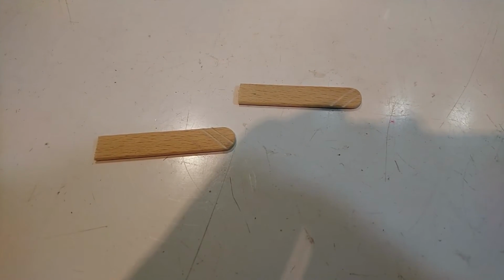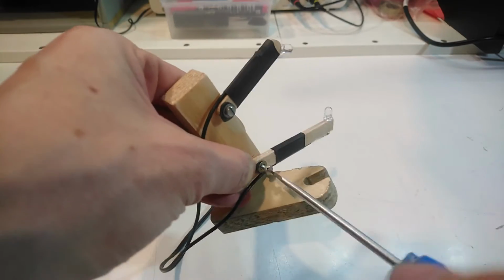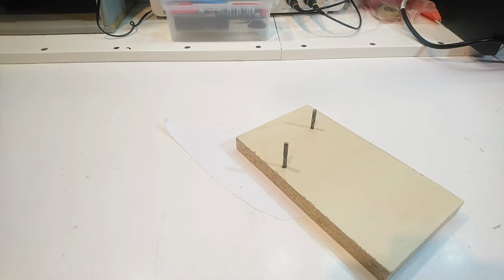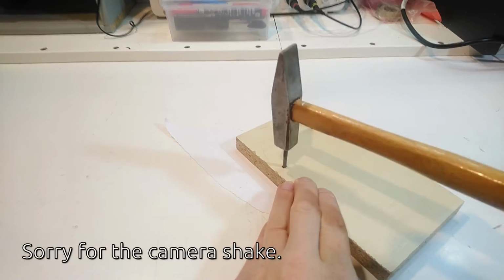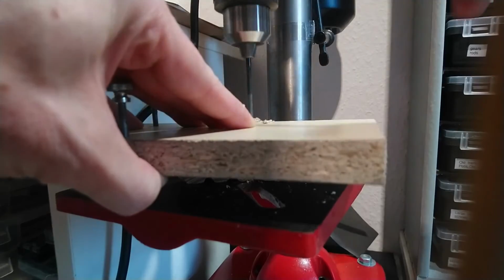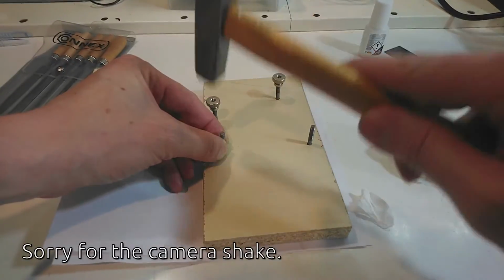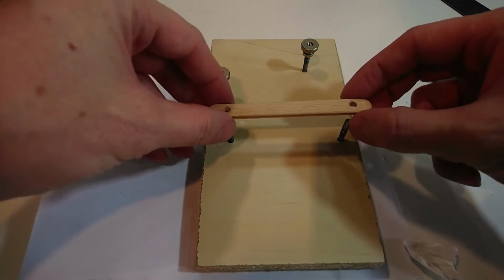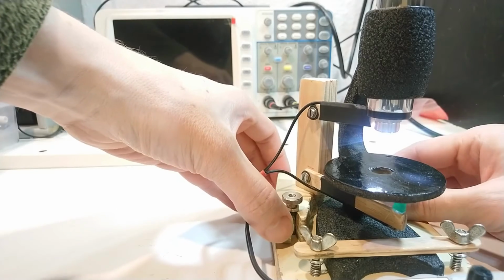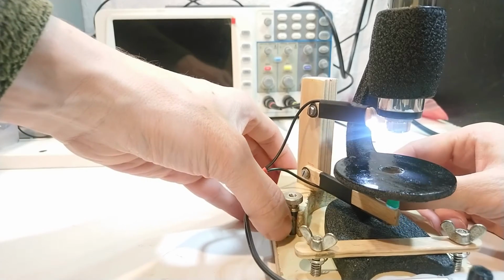I made two little arms that hold an LED at the end. They are attached to a little vertical tower that sits on a fiberboard stand. Then I make a base plate that has threaded rods glued in place to hold the tower in its position. Two more threaded rods are added to clamp down the microscope using a wooden clamping bar. That setup allows me to adjust the position of the lights and the microscope and then lock everything in place.